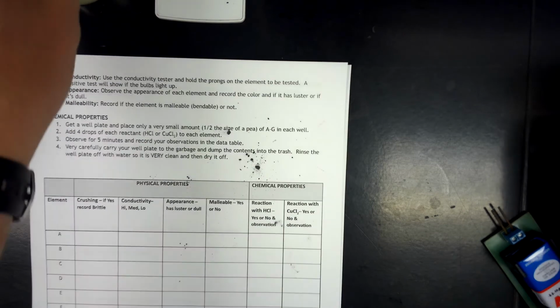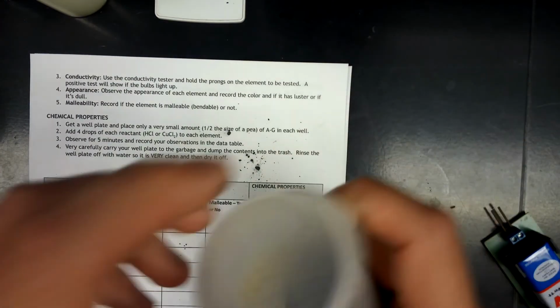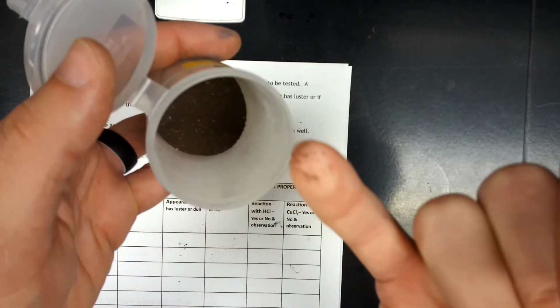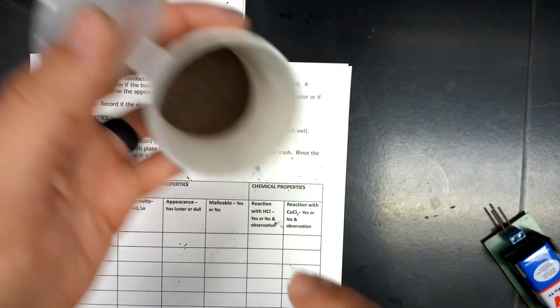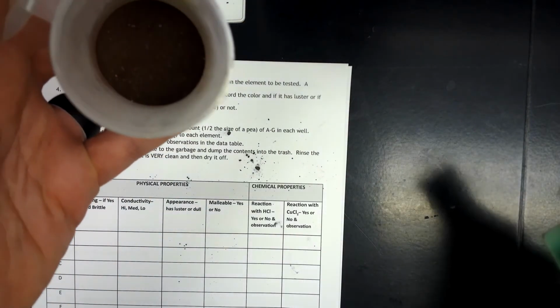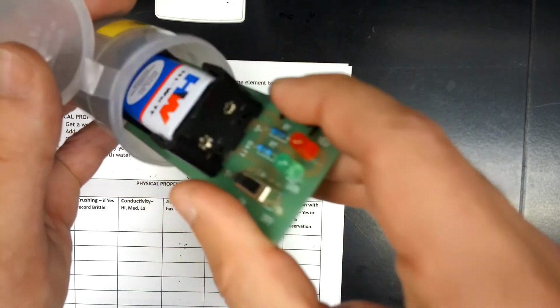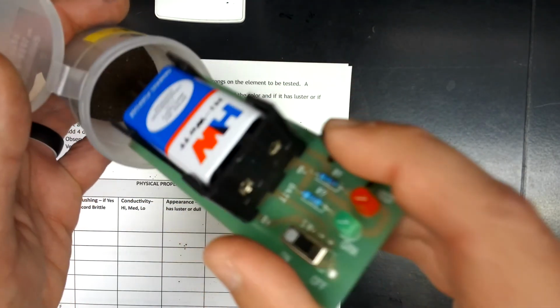And lastly, F, you heard me right. Lastly, we need to delete that G one. We don't have a G this time. This one's harder to see, a brownish color. Stick my finger in, comes out with just little pieces, but not coated. So it is malleable, but not crushable. And it is not conductive right now.